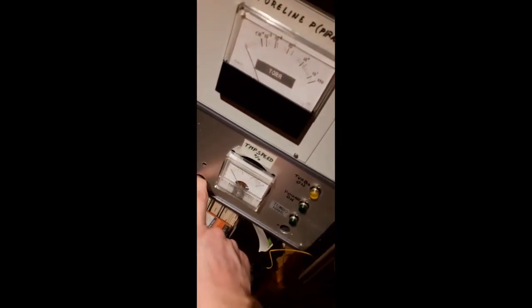The pump is controlled by this little controller here. This is just one of those small EXDC controllers. This is the 160 model. This is actually like a VFD. It makes three phase AC out of 80 volts DC. And the 80 volts come from this. This is the control unit for the turbo pump. I've built this myself.